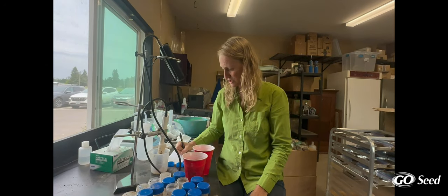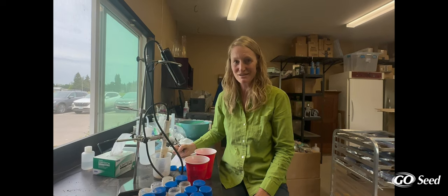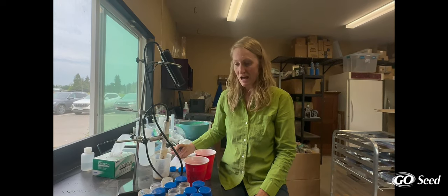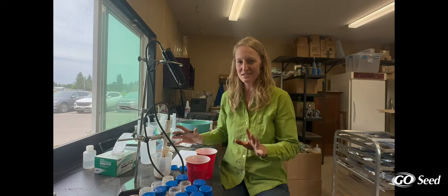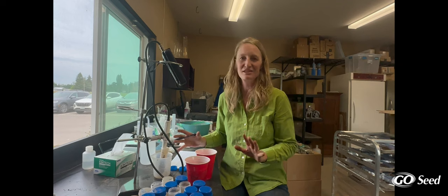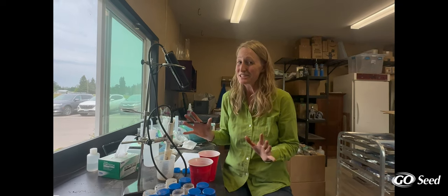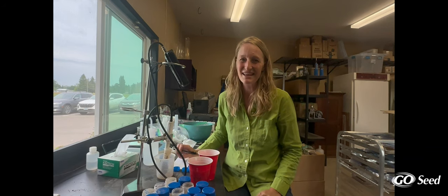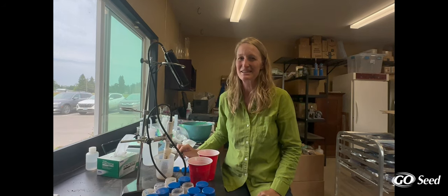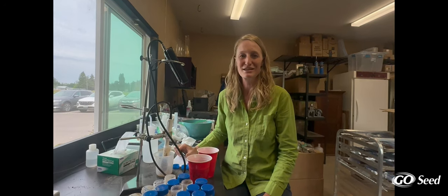I'm also checking electrical conductivity just to have the measurement, because all I have to do is push one button and I've got it. I have only taken measurements on one replication of each of the treatments so far. I can't say anything much, but it does look like the pattern that we saw from our last set of experiments has a chance of holding true. I just have to keep measuring and wait until I can run the statistics to see if there's actually this phenomenon of the annual ryegrass increasing the pH like we saw last year.